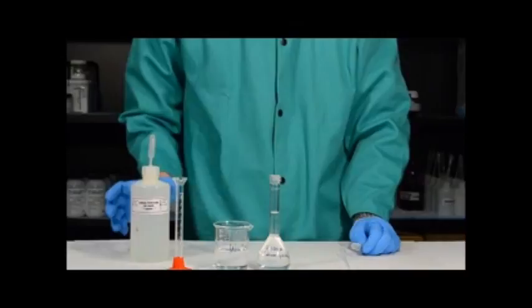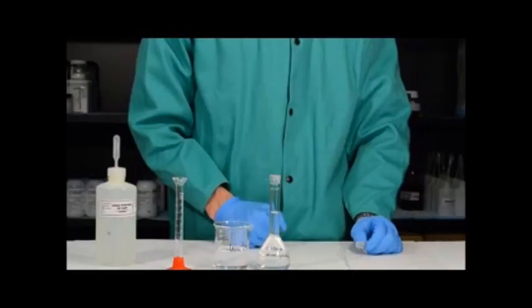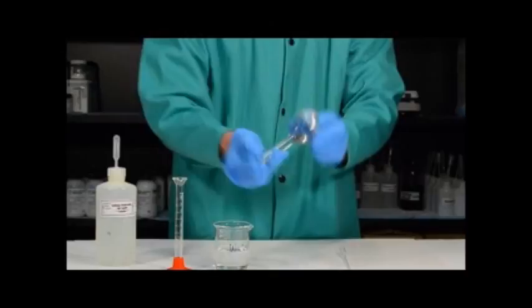Finally, we need to mix the solution. 5 molar sodium hydroxide is far more dense than water, so if you were to use this solution now it would not be uniform throughout. To mix it, simply place the stopper on the flask, place your fingers over the stopper to make sure it doesn't fall out, invert the flask and shake. Repeat this process several times, making sure to hold the stopper, until you have a uniform solution.